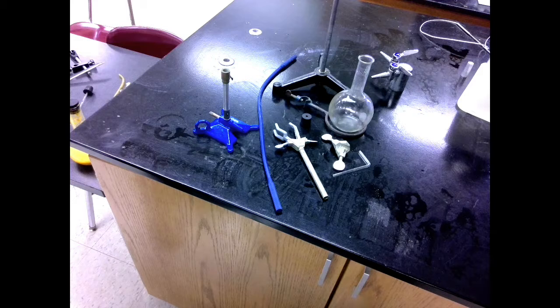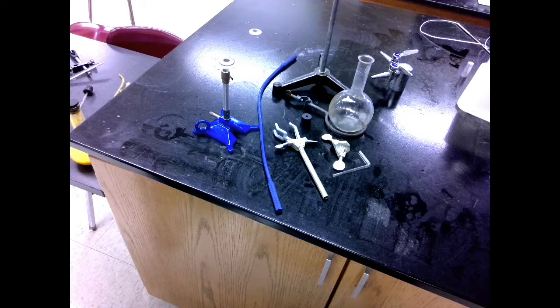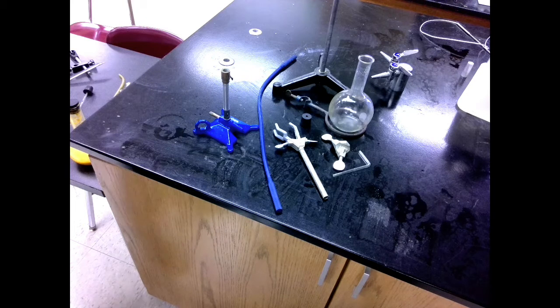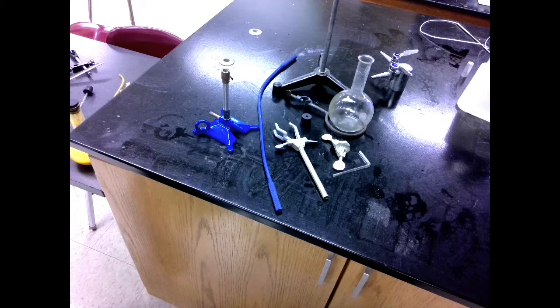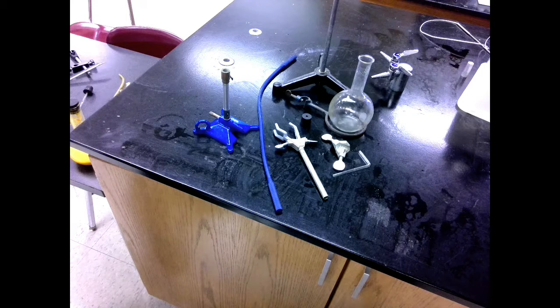So we need to produce a good amount of steam at a fairly even rate. To do this, we're producing the steam separately from our organic material.